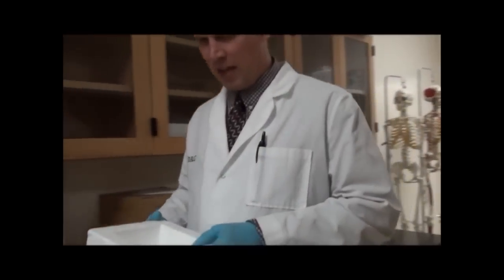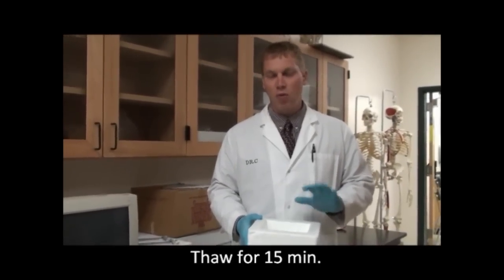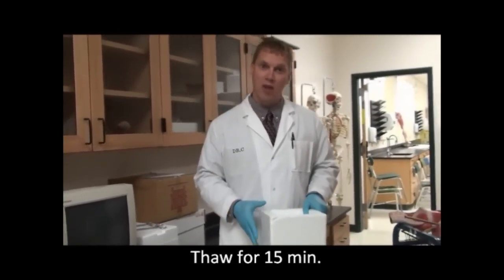Now we'll take our sample back to the classroom. This needs to sit on ice for about 15 minutes and thaw out, so we'll go back and let these thaw.